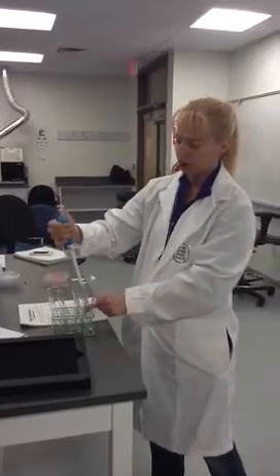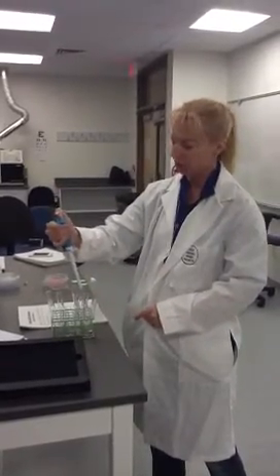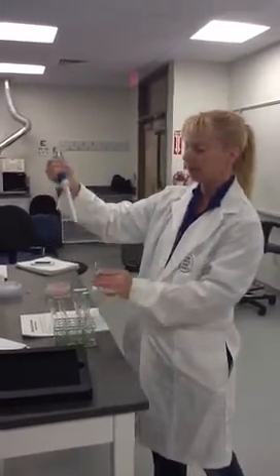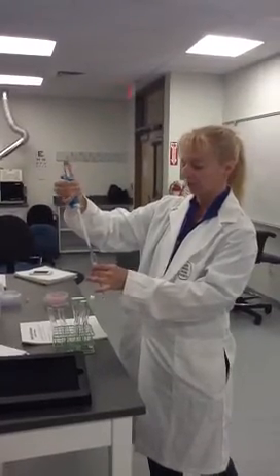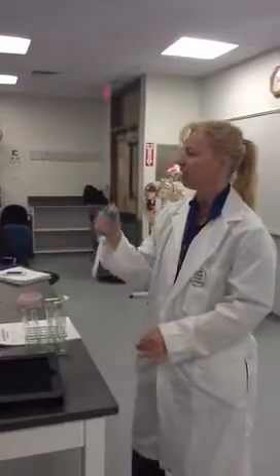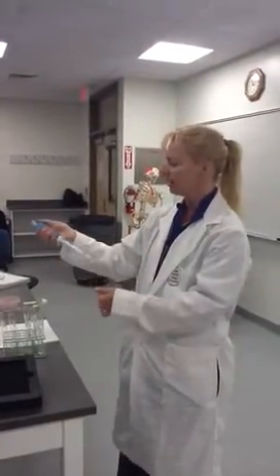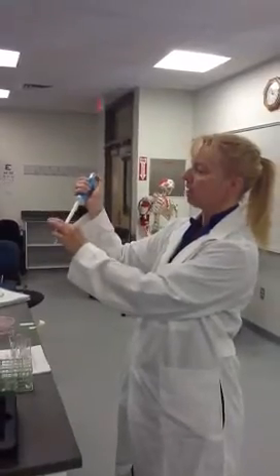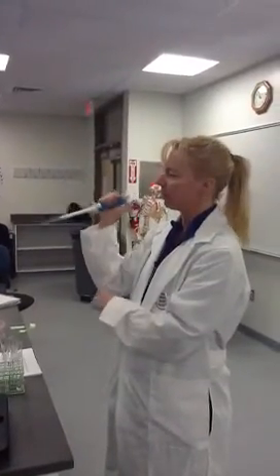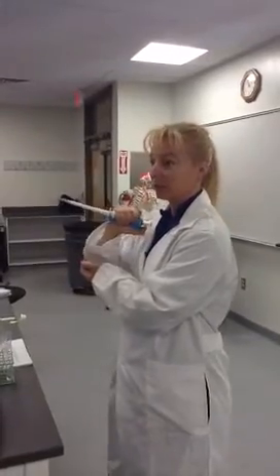So when I would push it into the water in there, you push it down, it sucks it up. What would be transferred into the next tube would be 1,000 microliters in there. The way that these are supposed to come off is this is a handle that would push off on here. These tips don't fit real well on here, and so they're not popping off like they normally would.